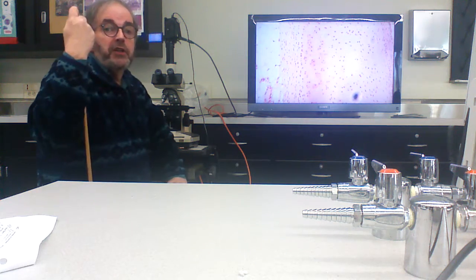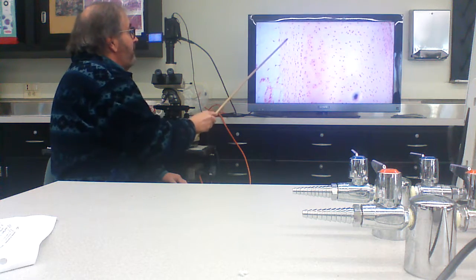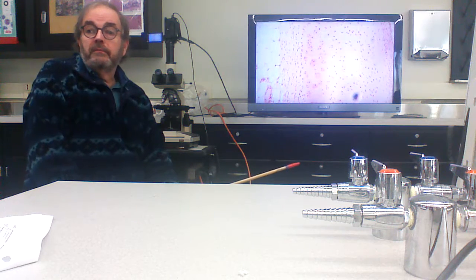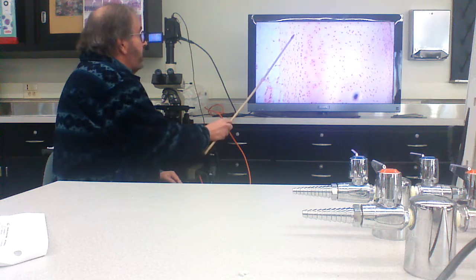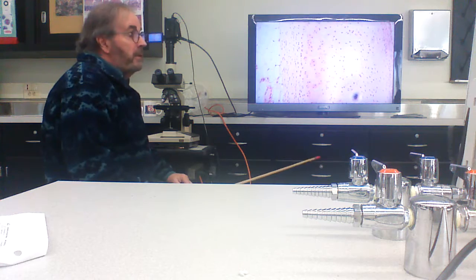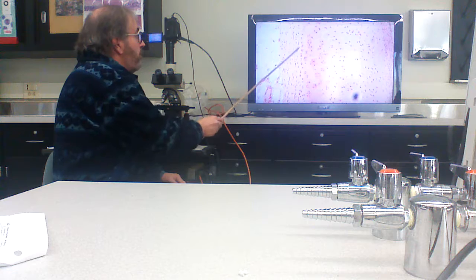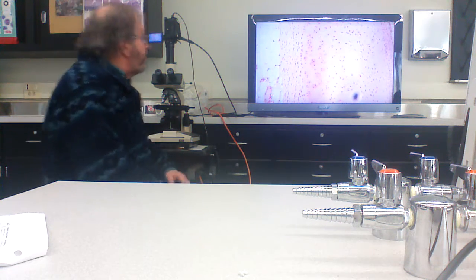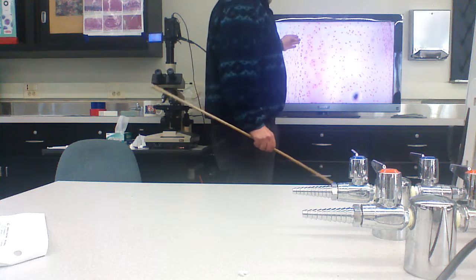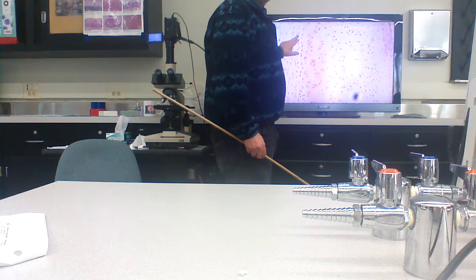And what happens is they're secreting it around them in all directions. So the cartilage is growing, right? But it's growing as you're adding new extracellular stuff. And we call that growth, from the outside, appositional. Right? So what happens is, these guys turn into chondroblasts, they make cartilage, they seal themselves in the cartilage network.